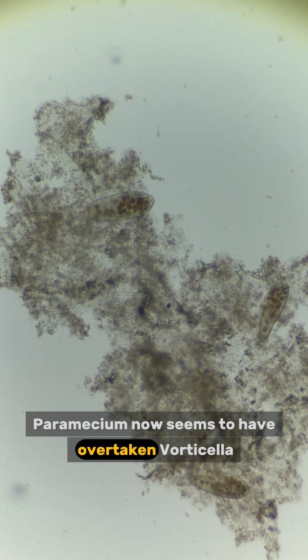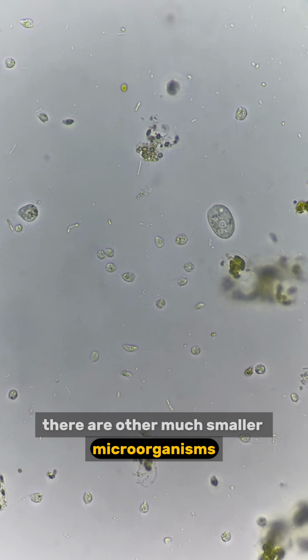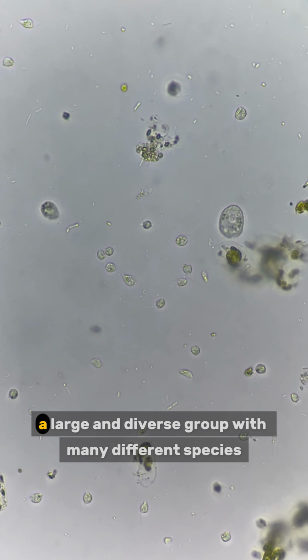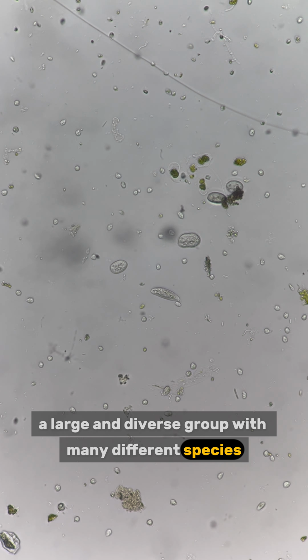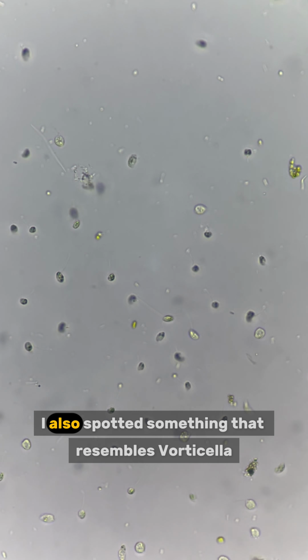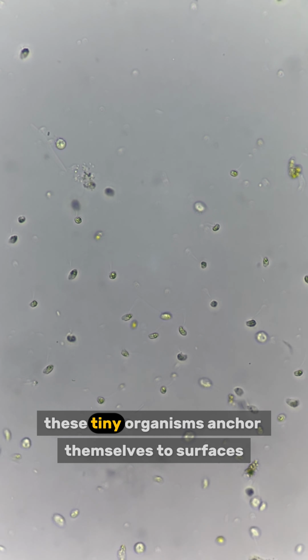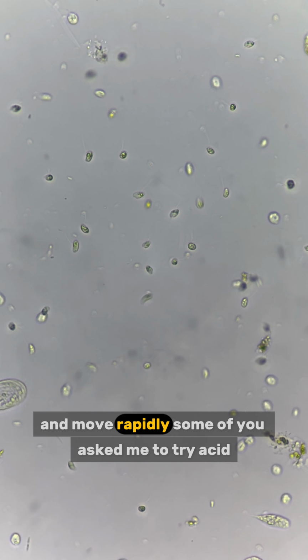Paramecium now seems to have overtaken Vorticella as the dominant species in the sandbox. Besides them, there are other much smaller microorganisms. They're mostly ciliates, a large and diverse group with many different species. The predator has returned. It's like the microscopic lion of this ecosystem. I also spotted something that resembles Vorticella, but it's at least 100 times smaller. These tiny organisms anchor themselves to surfaces and move rapidly.